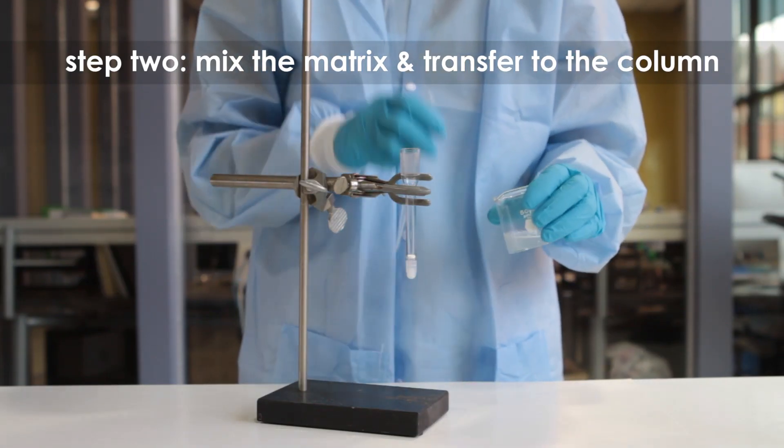Step 2: Mix the matrix thoroughly by swirling or gently stirring.